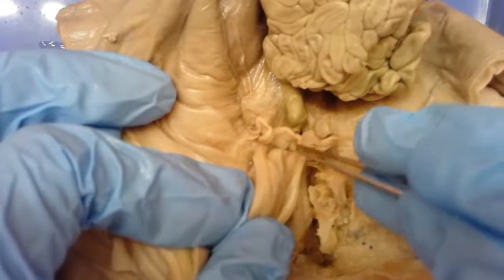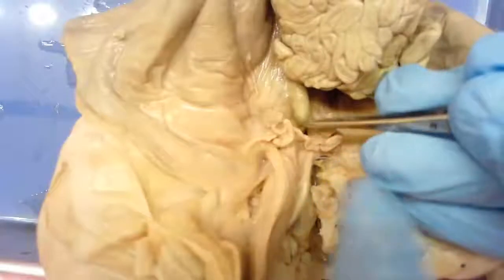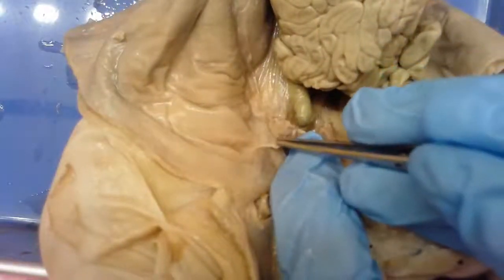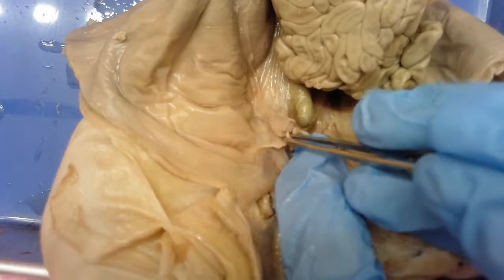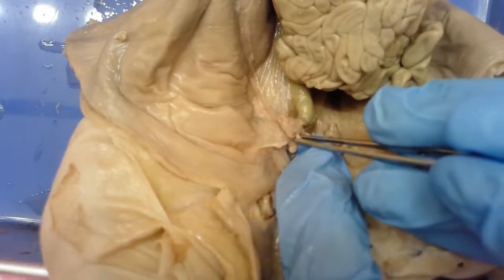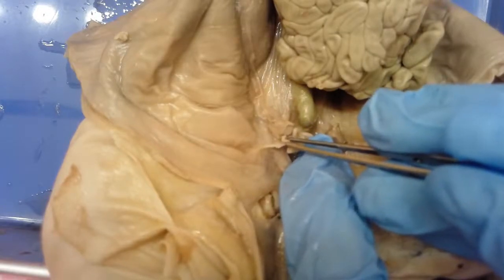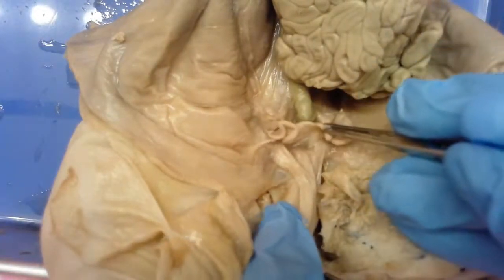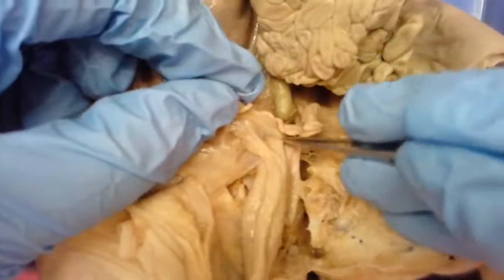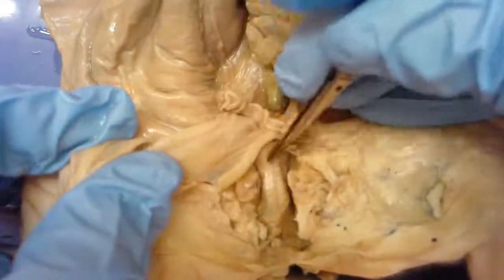These structures are often confused with the fallopian tubes, because in humans the uterus, fallopian tubes, and ovaries come next. But if you look really closely, there's actually a series of little coiled tubes surrounding the ovaries - those tiny ones are actually the fallopian tubes, right at the very end of the horn of the uterus. The fallopian tubes in pigs are pretty short, and this is where the egg and sperm join during fertilization. Here are the horns of the uterus and the main body of the uterus connecting downward.